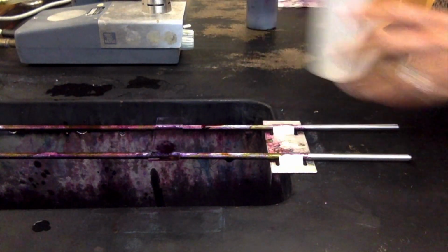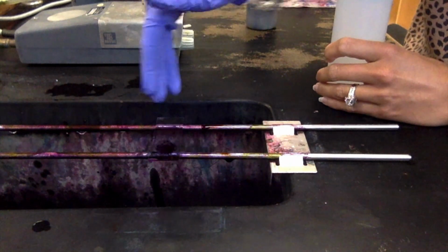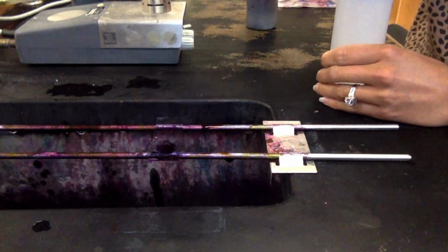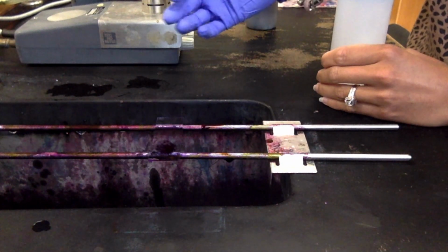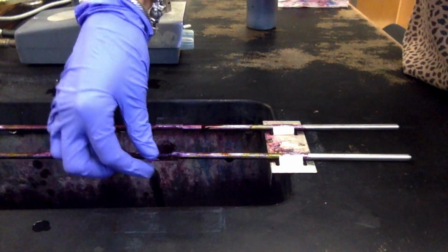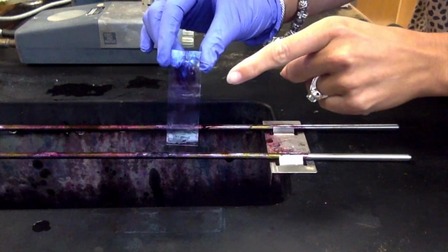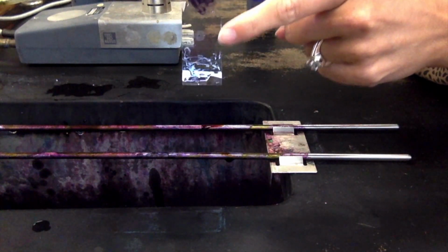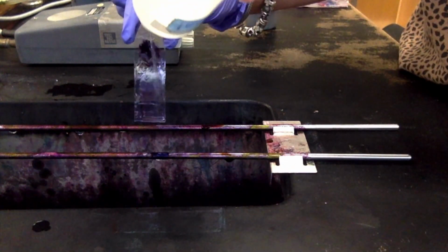Alright, so now comes the alcohol, and you're going to do this a little differently. You're not going to just put it on the slide and let it sit. You're actually going to want to see that runoff. You want to see it come off. And of course, my E. coli smear is the gram-negative, so that's the one the color should come out of first, and then the staph smear should stay the same. It should still stay purple. So you can already see that my staph smear is really, really dark, and then my E. coli smear is really, really light, okay? So it's kind of already hard to see. So we're going to rinse with our alcohol.